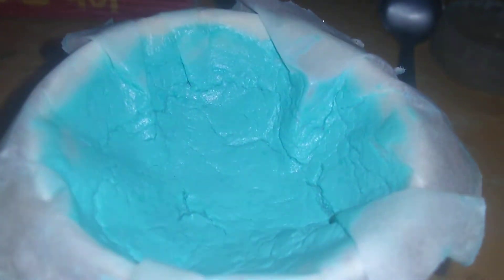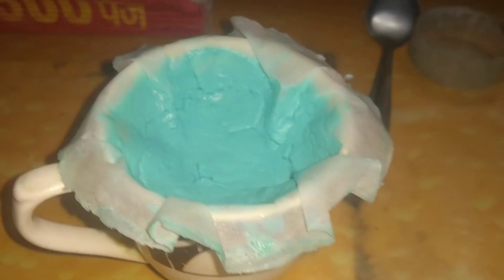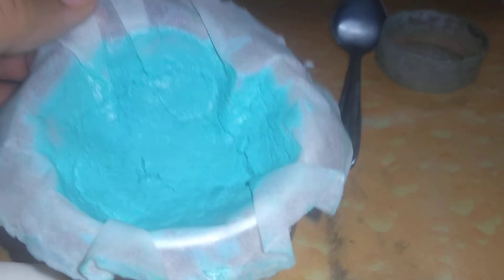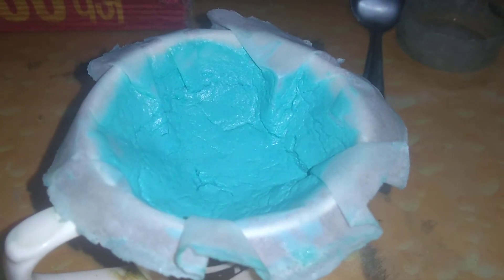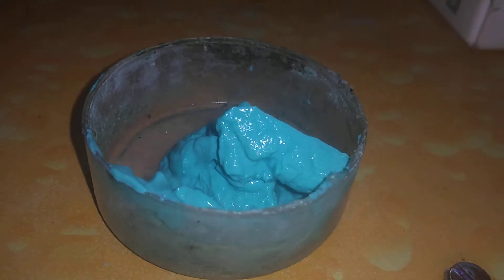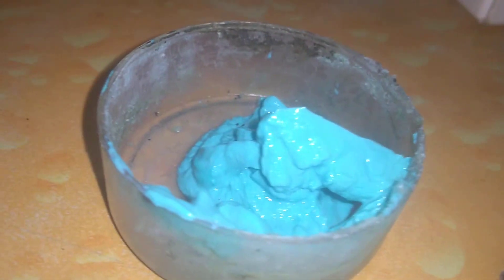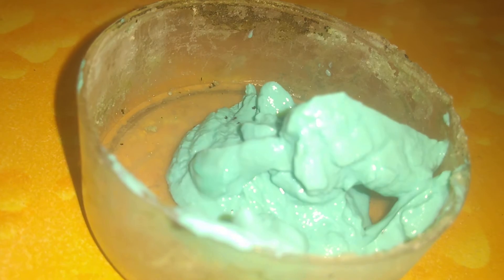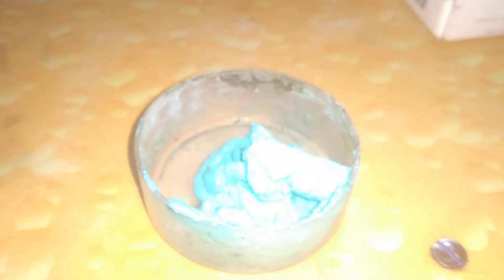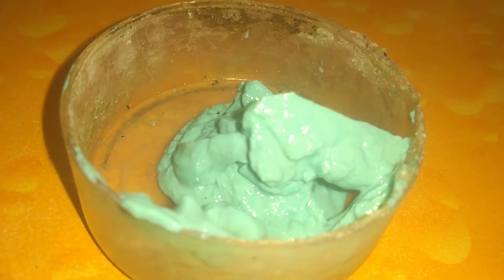It's been about eight hours and as you can see it's pretty much all drained out. What we're left with is pure copper hydroxide. You can see by its beautiful blue color — it's almost pure. It's going to have a little bit of impurities, but it's good that we have almost a pure product.